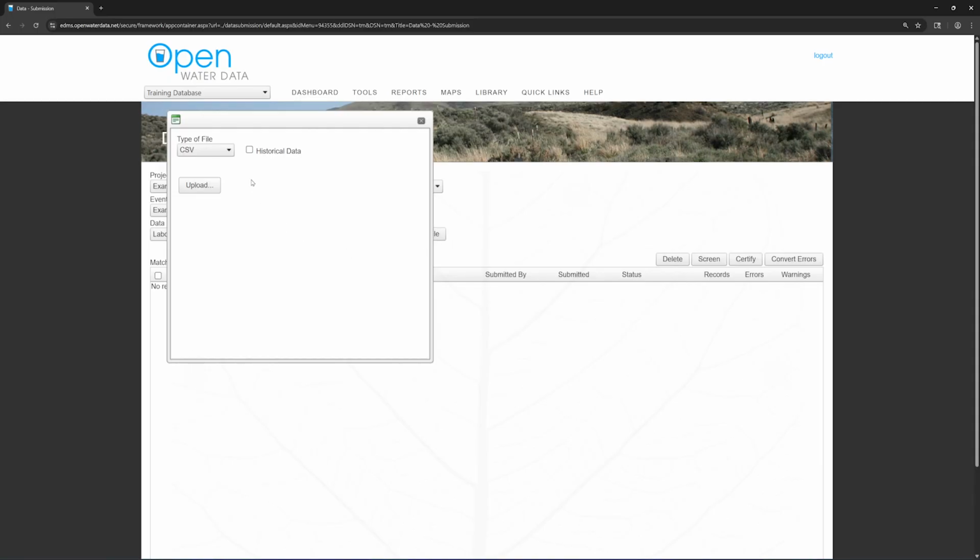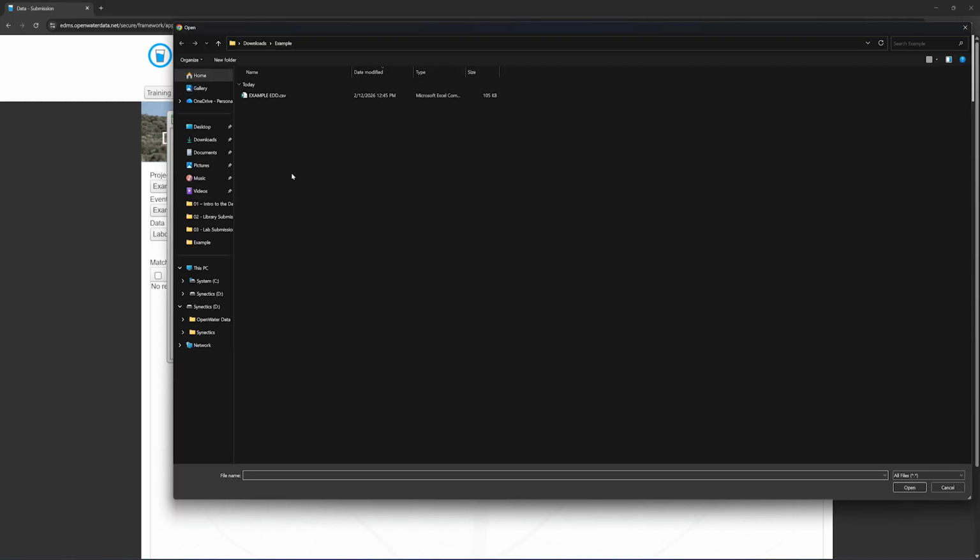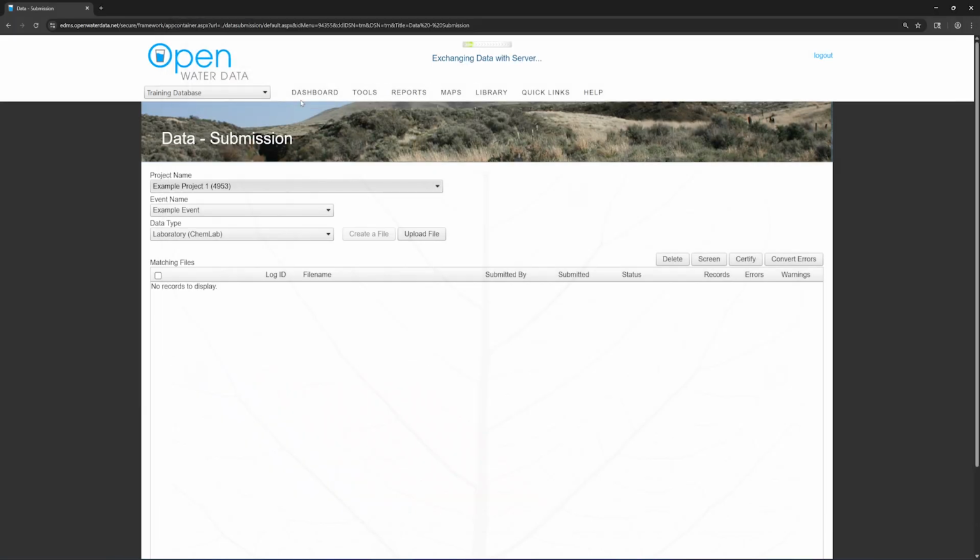Choose the correct type of file. Fixed width, pipe delimited, and tab delimited files are all different ways of organizing the data in a TXT file. In this case, we will choose CSV because that is the type of file we have created. Click Upload. Select the file. Once the file is uploaded, select it and click Screen.